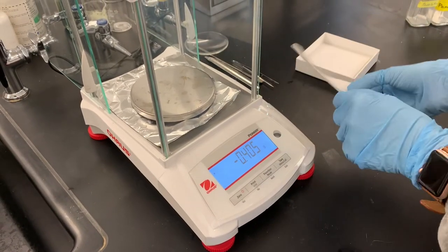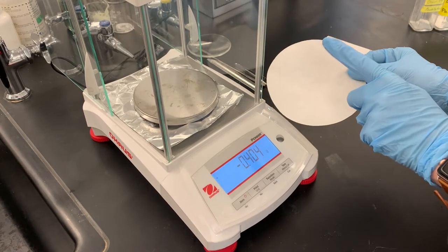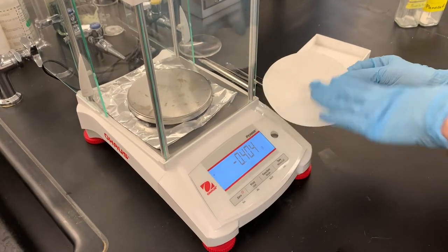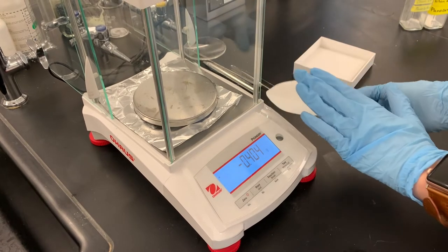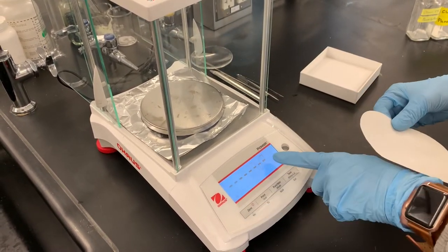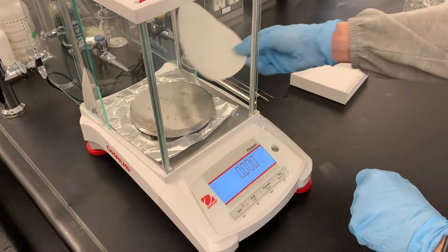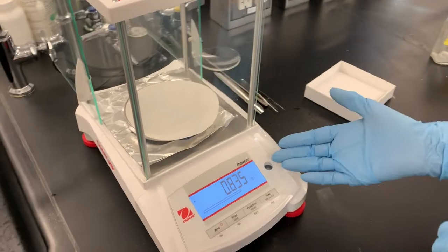One thing we're going to do to make this experiment easier is pre-weigh a piece of filter paper. We're going to be collecting our product in this filter paper, and there's not going to be very much to collect. So we'll get an initial mass of just the dry filter paper, then once we get our product in it we'll re-weigh it to calculate how much product we have. I'm going to start by zeroing the balance and then record the mass of the filter paper.